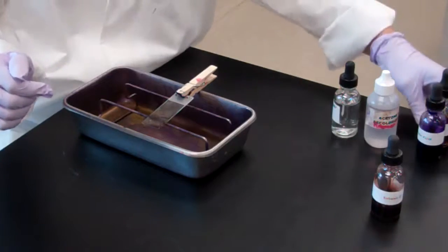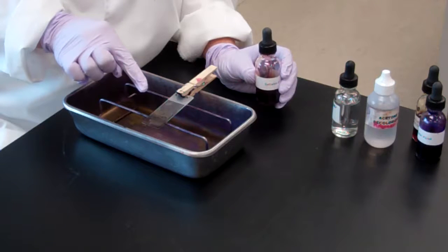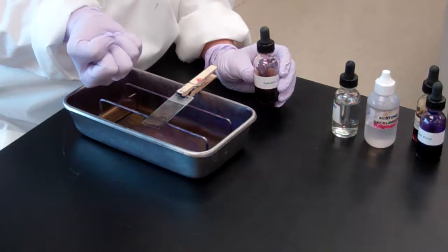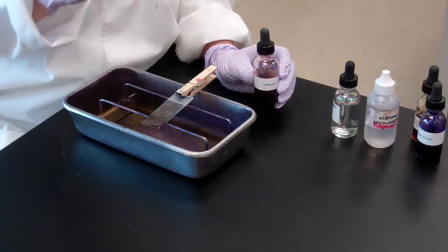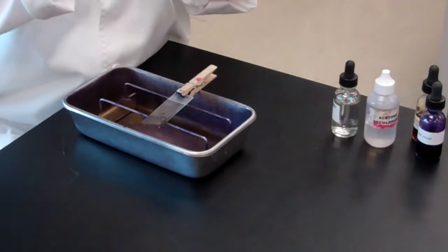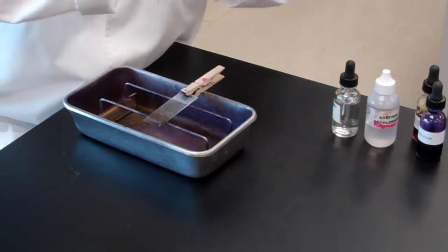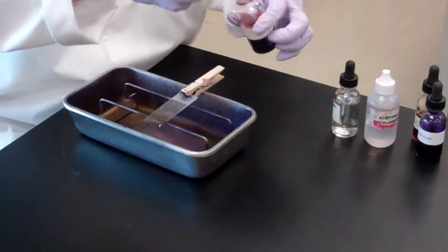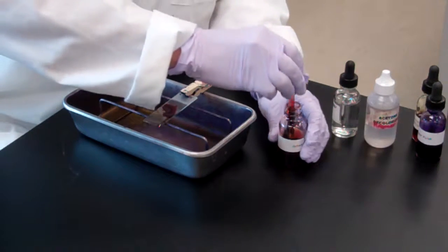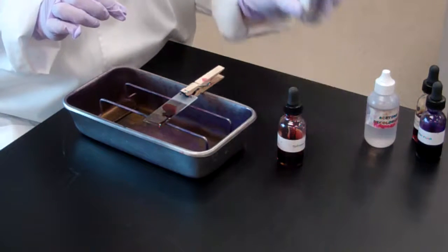You rinse, and now you add what we call the counter stain. The gram-positive bacteria right now should still be purple because that iodine has that crystal violet on the peptidoglycan. The gram-negative organism right now is clear. It's colorless because the acetone washed that color away. So we add this counter stain: if I have a gram-negative organism, it's clear, and I've got to add some color to it so I can see it under the scope. You add your safranin. That's going to sit for 1 minute. After that 1 minute, you rinse with distilled water.